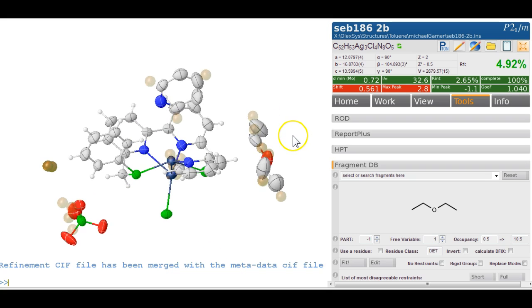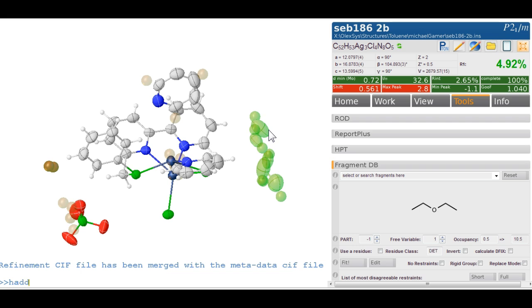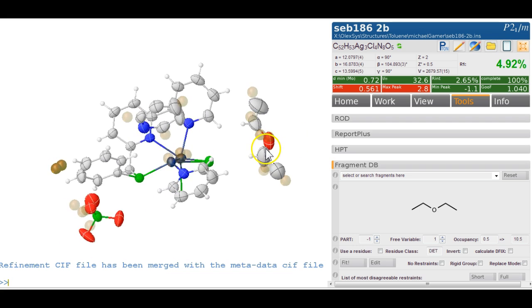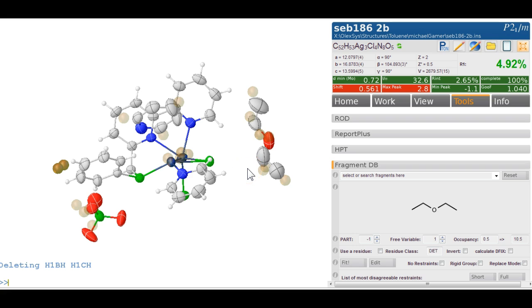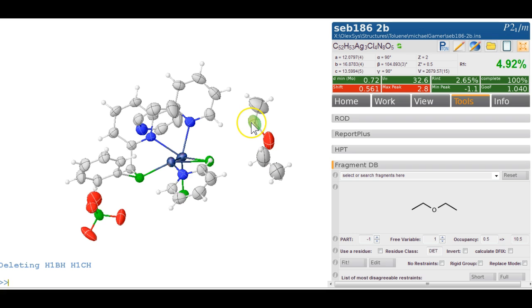That doesn't look unreasonable. I think we can try to H add on this, so not everything added properly. So in fact, it didn't add properly at all. So what I suggest to do here, this is a little trick as well. We can hide the Q peaks, and we know that this has got to be this. So I'm going to type h add 137, so that puts that in regardless whether the geometry really fits or not. 137, and that's a 23, and that's a 23. Let's refine this and see what we get.